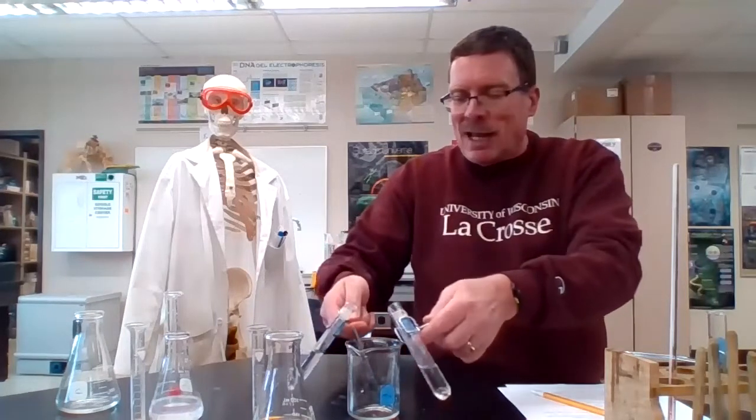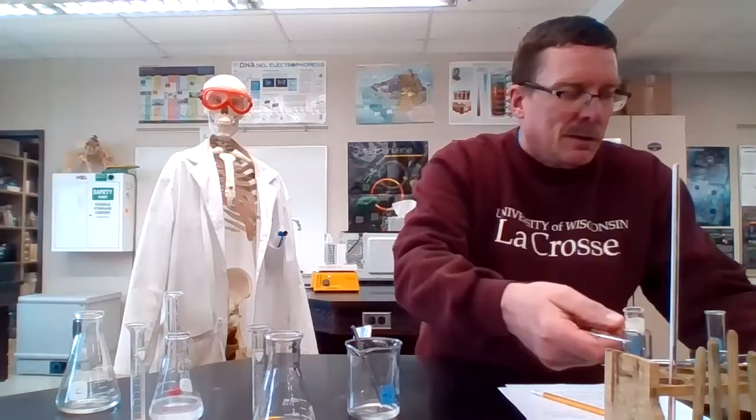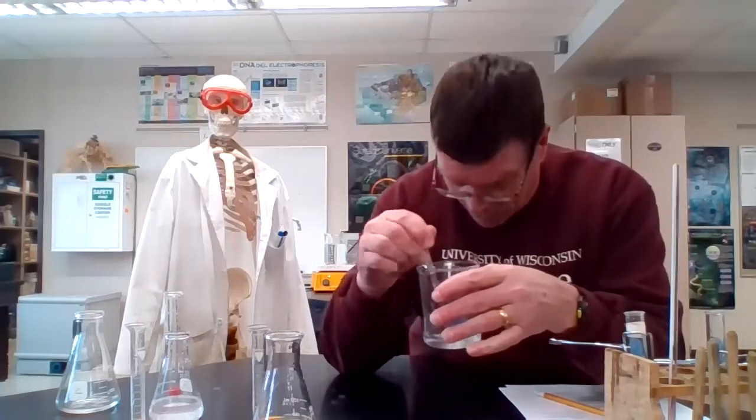I just put B in. We're going to hit the timer and again see how long it takes for this stuff to get going. Timer on. I'm going to start stirring. Kind of like yesterday, if it looks like it's going to go more than 5 minutes, we may end up pausing and coming back with the time on it.